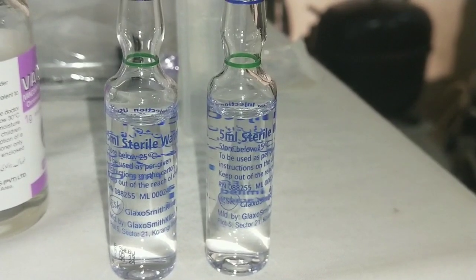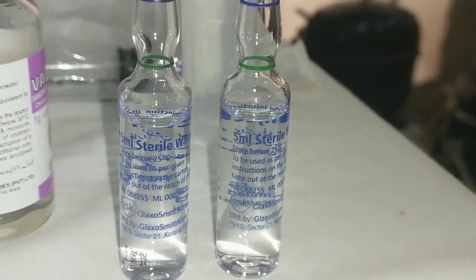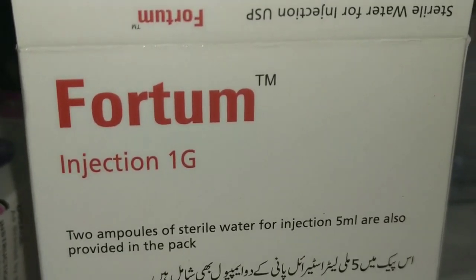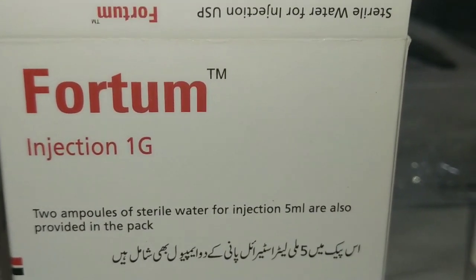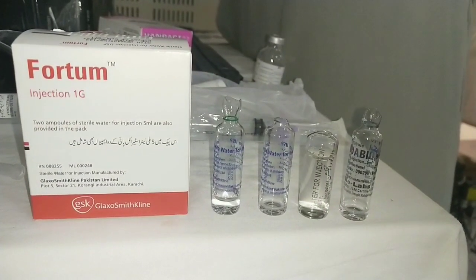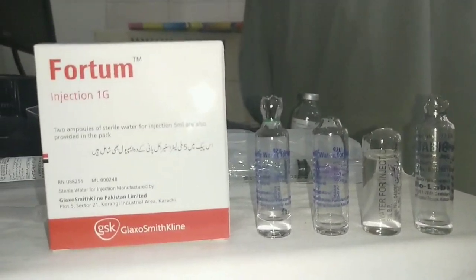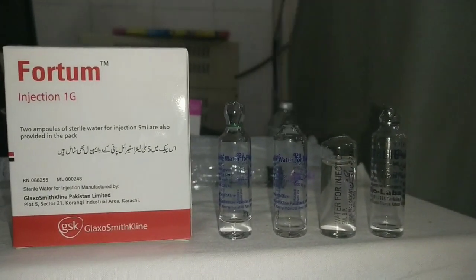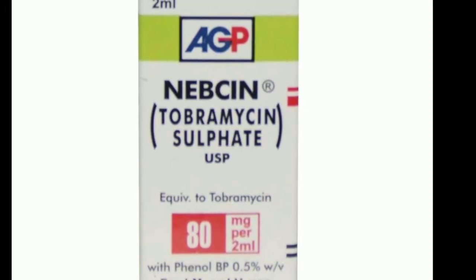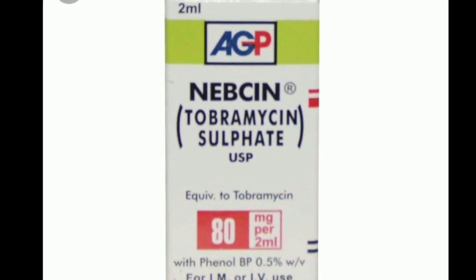The next antibiotic needed is gentamicin or tobramycin. These come in a fortified preparation of 1.5%. The routine preparation is 0.3%, but if that is not available in your area, you can make it easily: take one injection of 80 mg per 2 ml and put it into a commercially available solution of 0.3% gentamicin or tobramycin 5 ml, and it will become the fortified preparation.